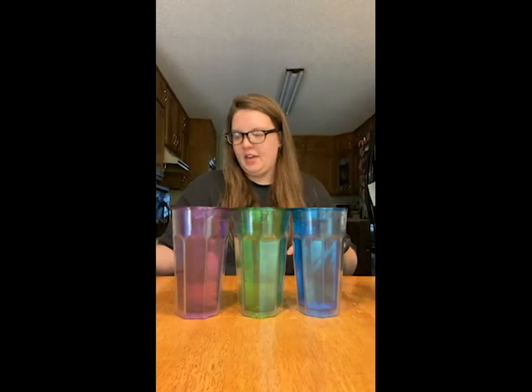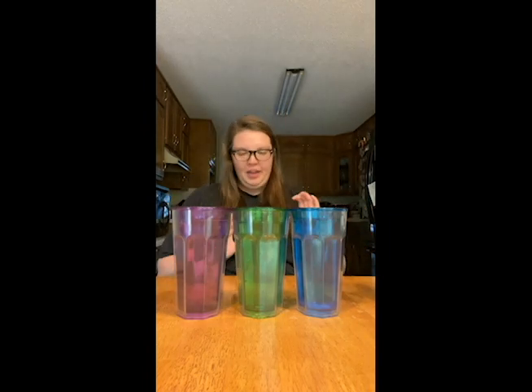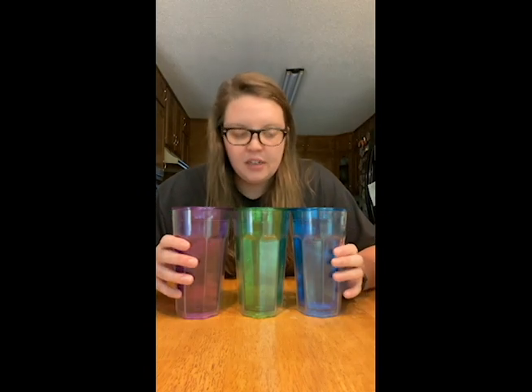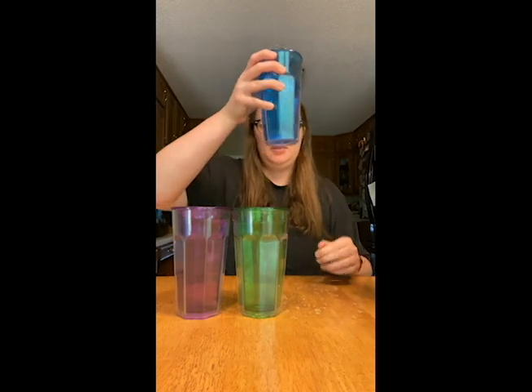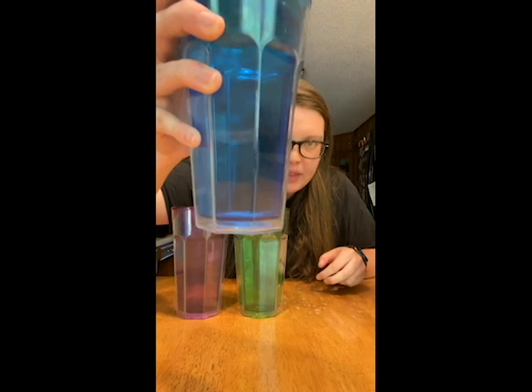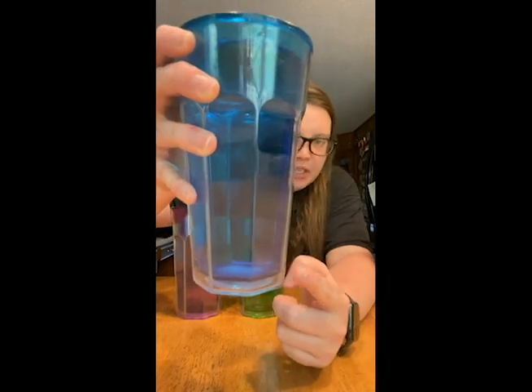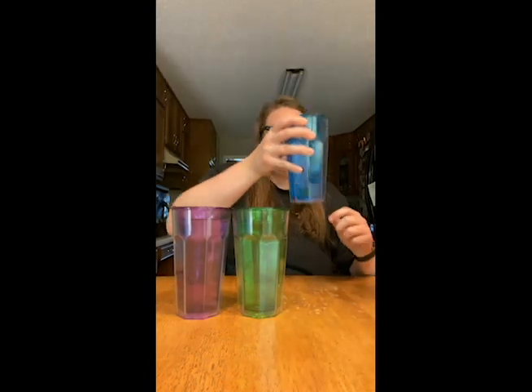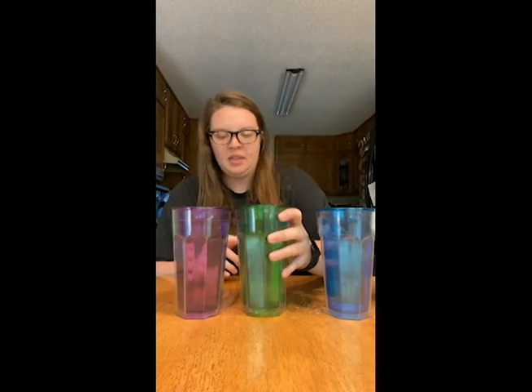All right, so we've got them stirred, and now I'm going to show you. There's definitely some differences here. You can't really see it, I don't think, but you can kind of see it. So there in the ice cold, you can see there's still a bunch down there settled at the bottom. Some of it dissolved, but a lot of it just settled back down.